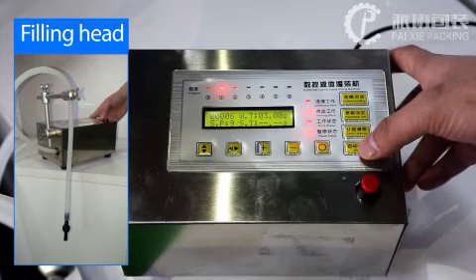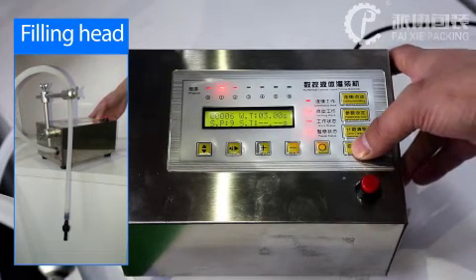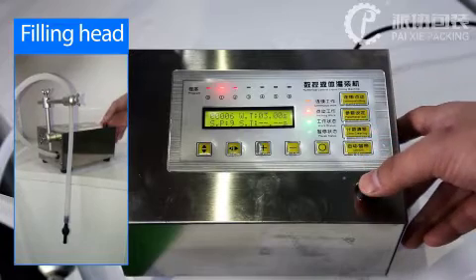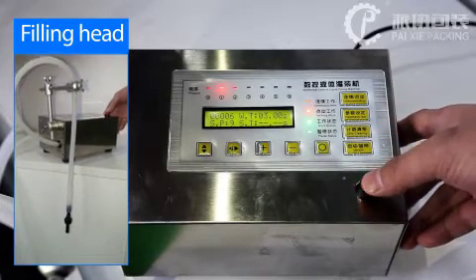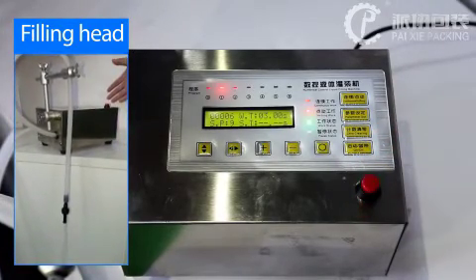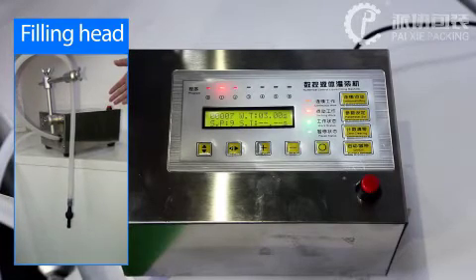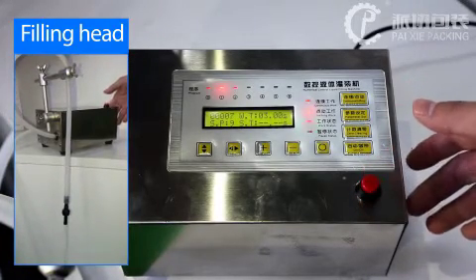And press power on, and press red button, and press again.